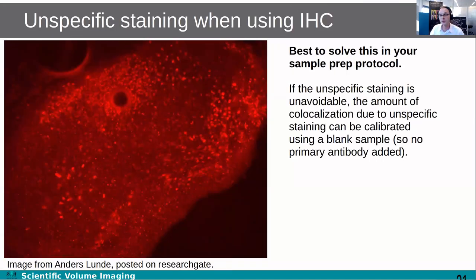Now, lastly, as an honorable mention, I'd like to mention unspecific staining. If you use antibodies and your secondary antibody doesn't uniquely recognize only the primary, but you have unspecific staining, maybe you get an image like this. I borrowed this from the internet from Mr. Anders Lunde, who posted it on ResearchGate. And yeah, so this will lead also to an increase of colocalization, so a false increase of colocalization. Because the unspecific staining is co-localizing probably, and that's not what you want.